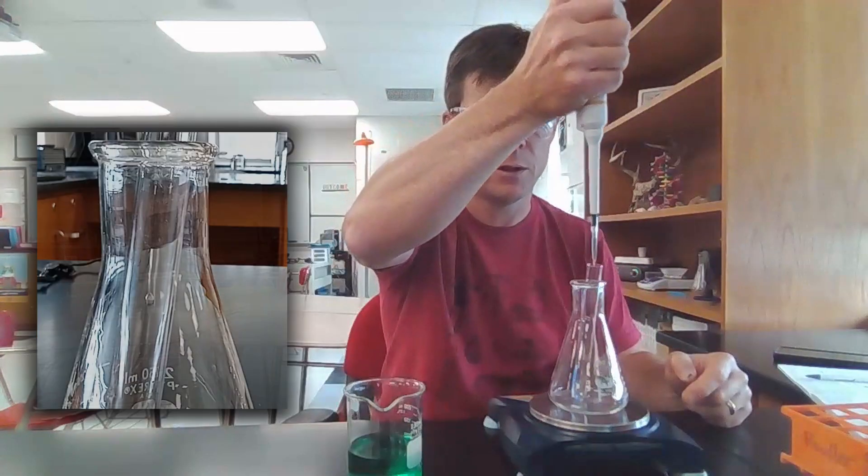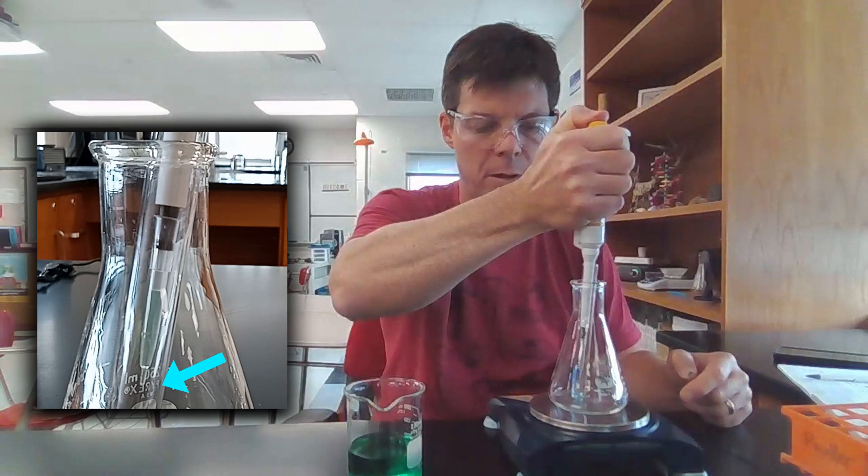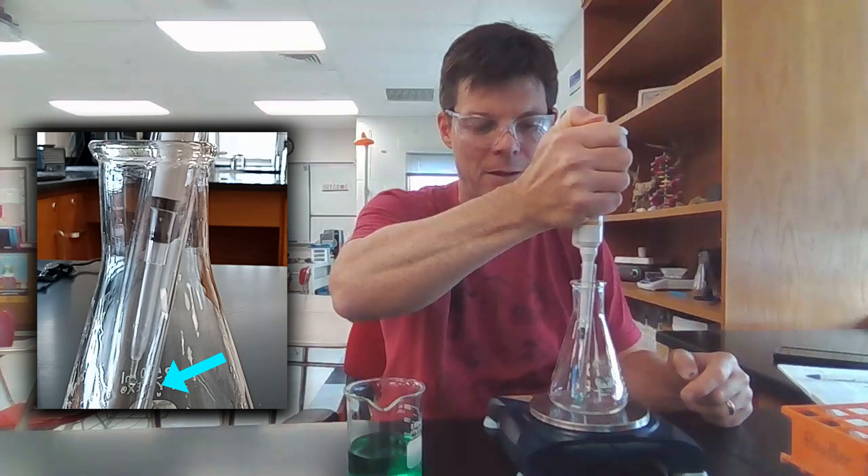I'm going to go into the tube as far as I can. First stop point, little bubble hanging on or a little bit of liquid hanging to the tip. Second stop point, that liquid has been pushed out. New mass of this is reading 109.9 grams.